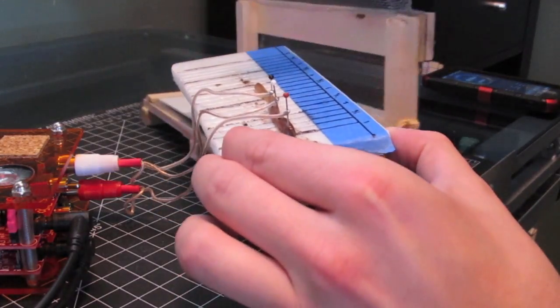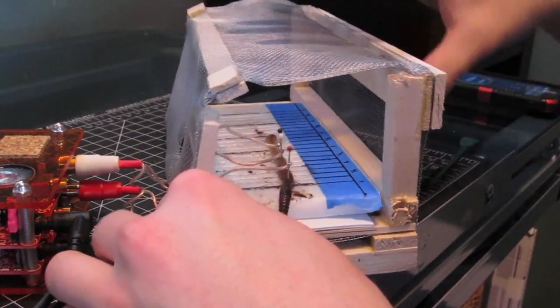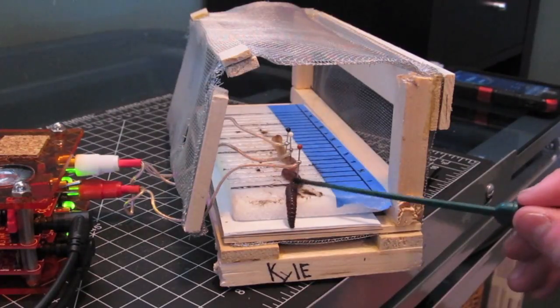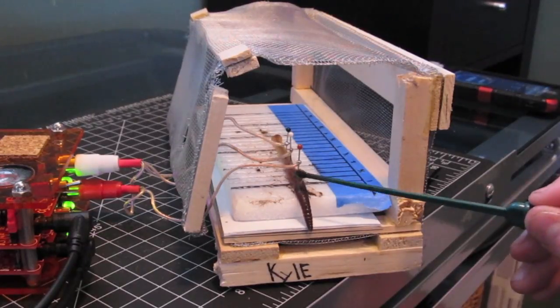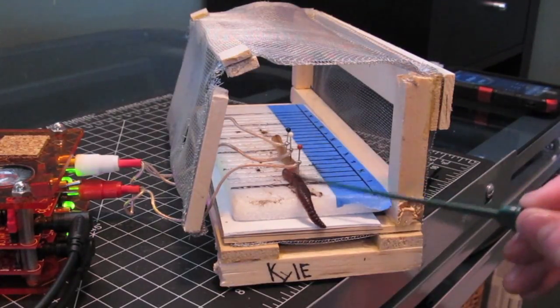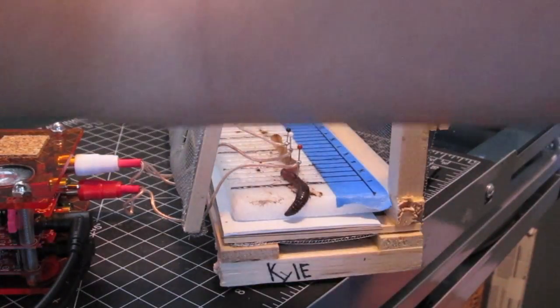Now place the earthworm with its anterior side facing you back in the Faraday cage, and turn the spiker box back on. Don't forget, you do not want to stop your Audacity recording during the experiment. That sounds like great neural activity to me. Once you hear some good spikes, go ahead and turn off the spiker box and stop the Audacity recording. Return the earthworm to its box and clean your electrodes. Next, you will be taking a closer look at the data you just recorded.